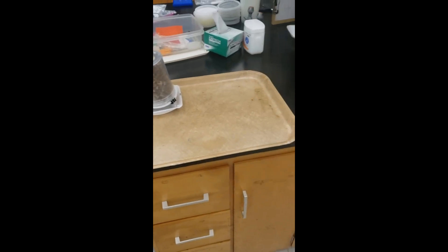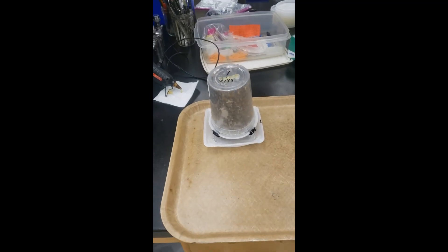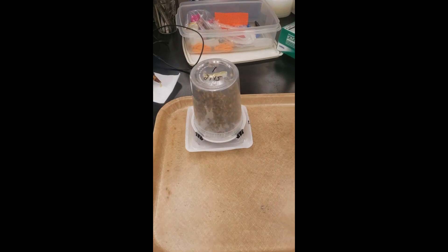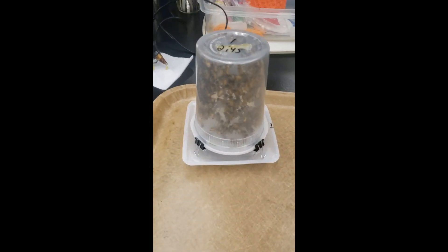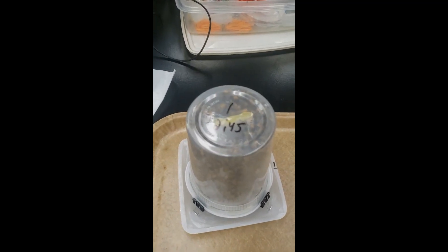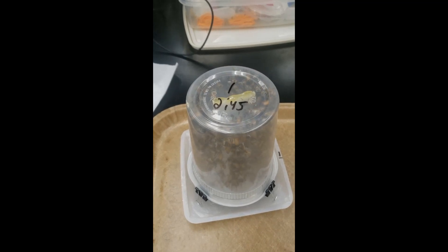This food cafeteria tray is a great place to put them on. Underneath a tree, in the shade of your truck, in the cab — somewhere where they're out of the wind and going to be stable. We found that temperature really doesn't affect this test very much, so just keep them in a stable place. We're now going to let these sit for three hours. We started at 2:45, so we come back at 5:45.